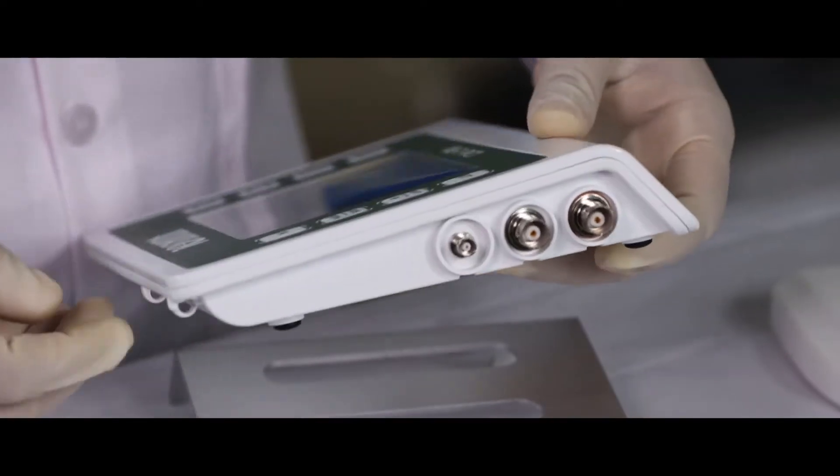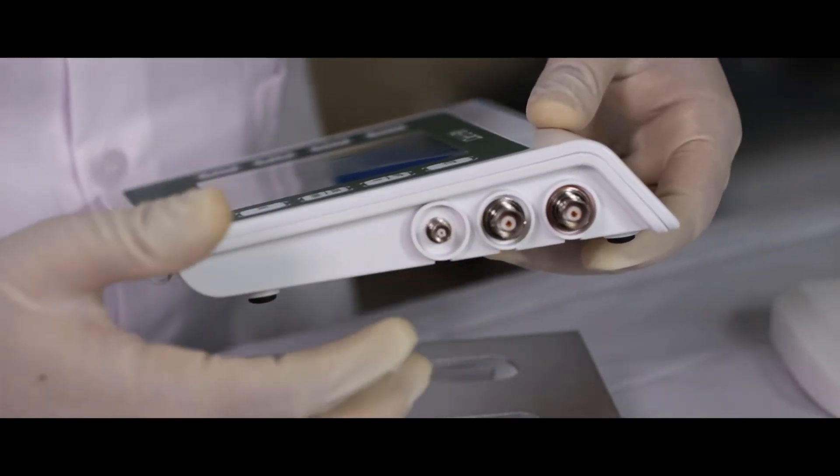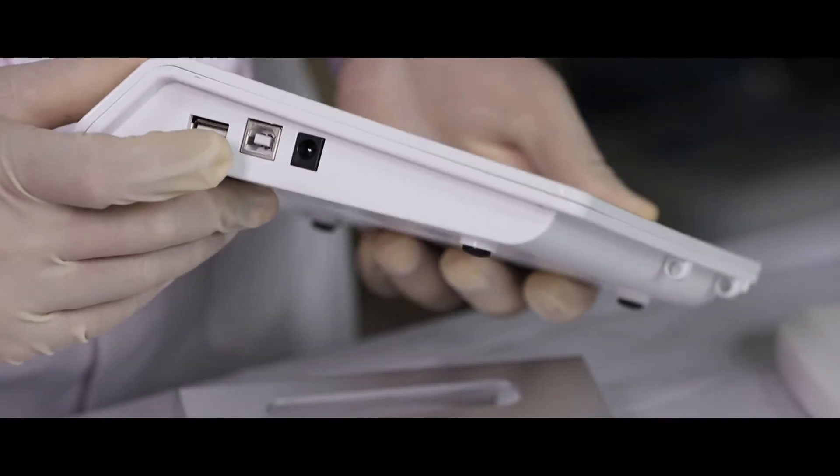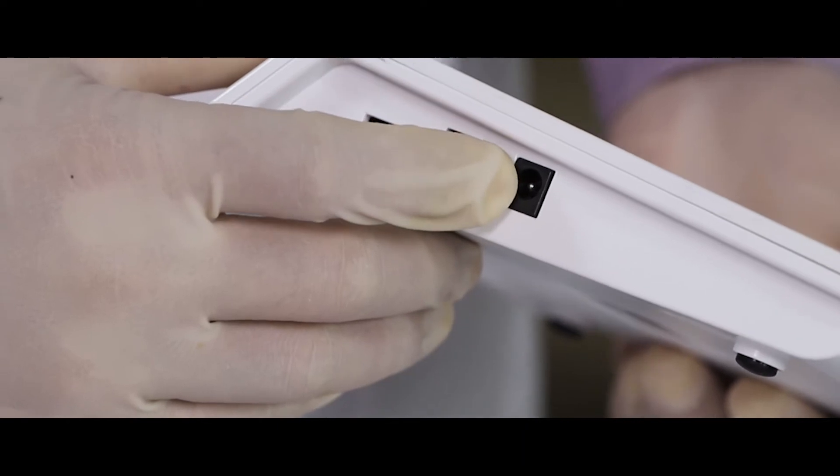Start with connecting conductivity, pH and temperature electrode, and on the other side USB and power source.